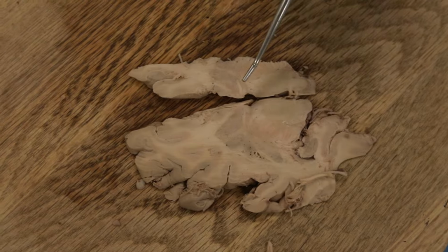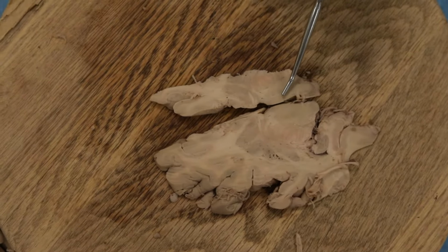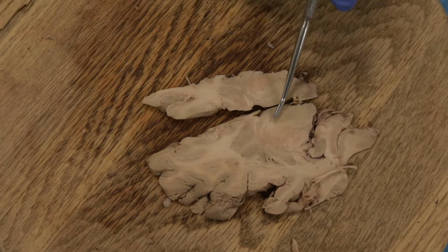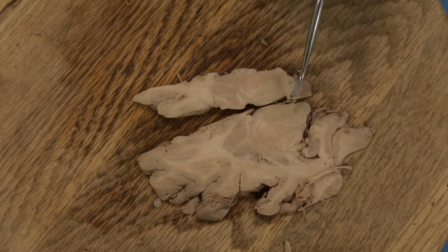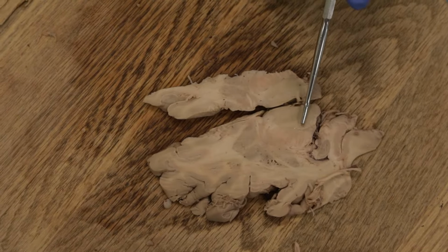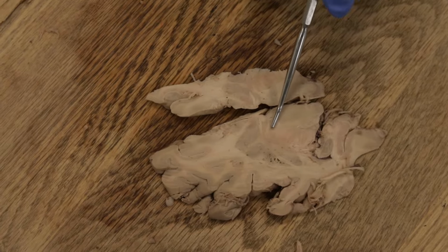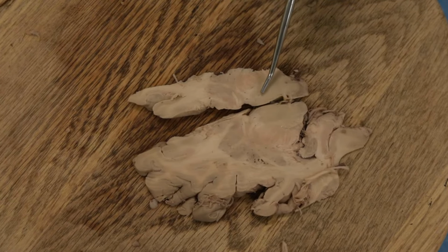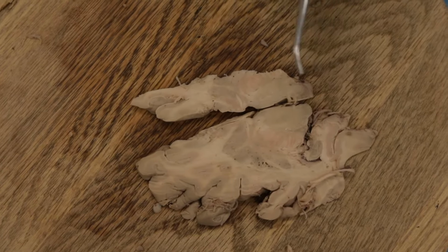Okay, so we're still in, most of this is thalamus here, but just a little bit, one section down, we're going to see that this is going to be the midbrain. So maybe that's an important point, that the thalamus sits right on the midbrain. So 1 millimeter, you're in the thalamus. We go just a little bit lower down, and you're in the midbrain. So this is kind of overlapping with the lower part of the thalamus and the upper part of the midbrain.